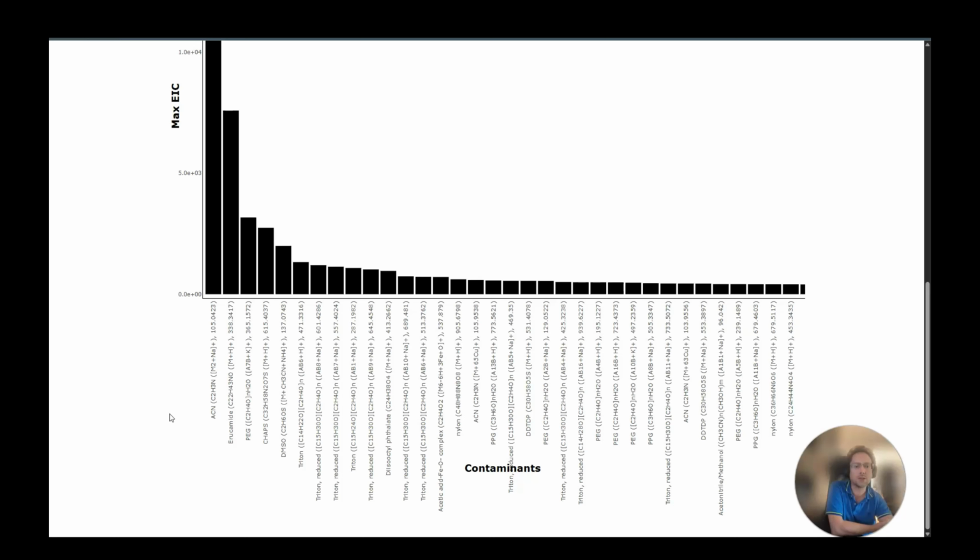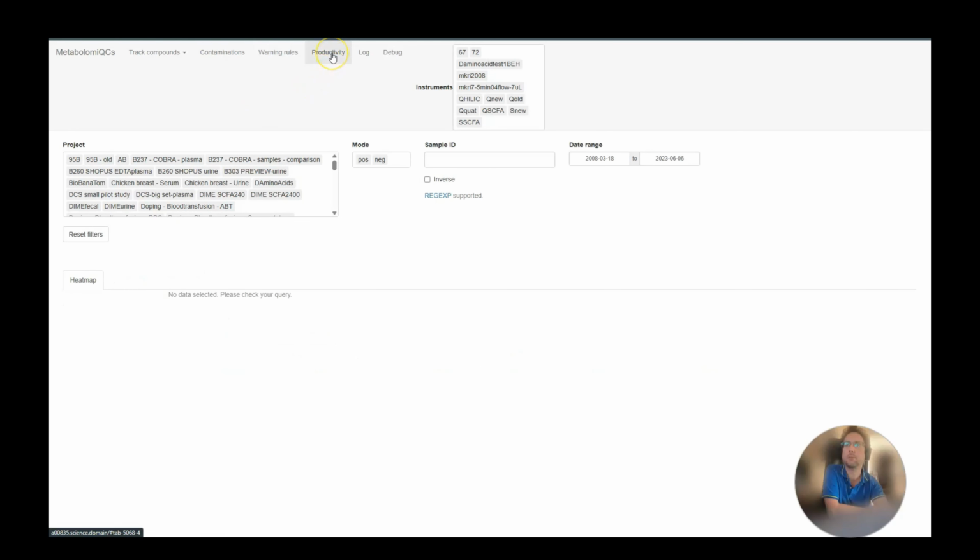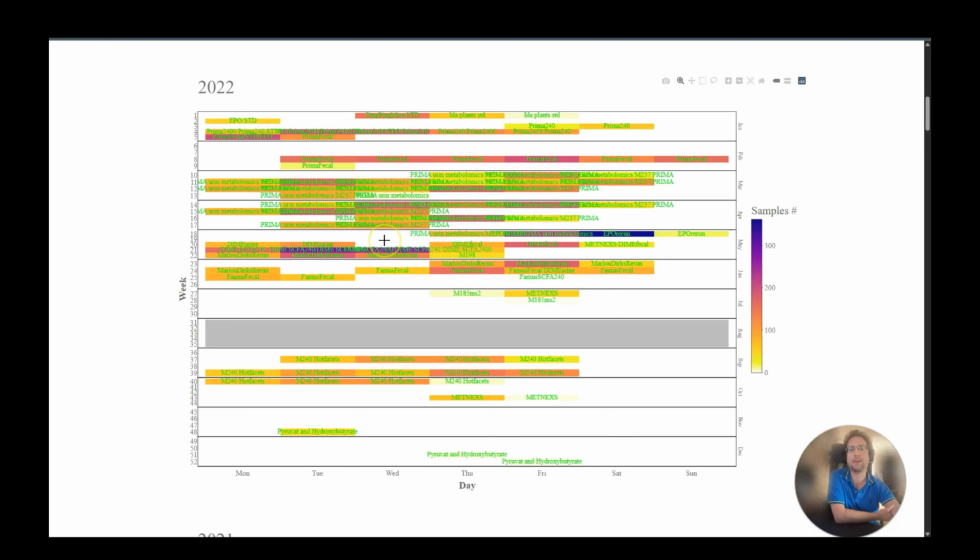Also, DMSO is listed, but in this case it might not be really DMSO, I think, since it is not a solvent we use. Of course, when you screen for 800 contaminants, you might sometimes get false hits, but it gives a general idea about what kind of stuff is in your samples, and in particular if something changed from previous analyses. We also have a productivity tab. That simply shows which projects were run when and how many samples were run each day.